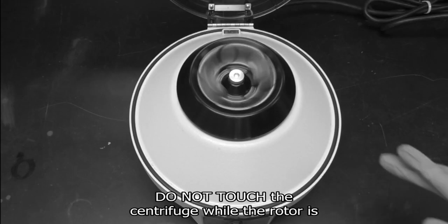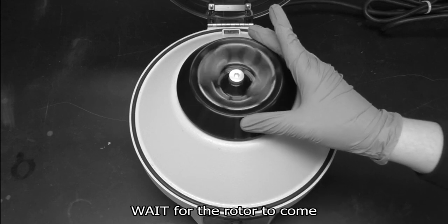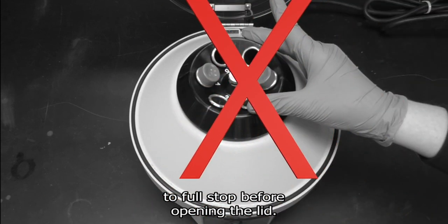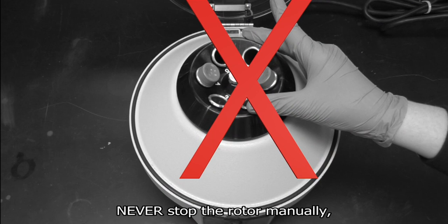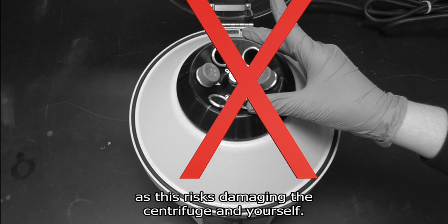Do not touch the centrifuge while the rotor is still spinning. Wait for the rotor to come to a full stop before opening the lid. Never stop the rotor manually as this risks damaging the centrifuge and yourself.